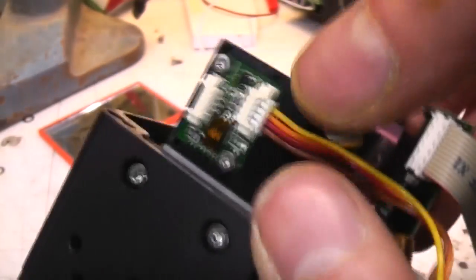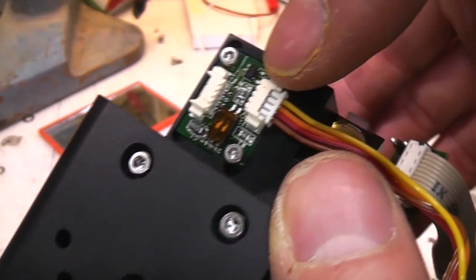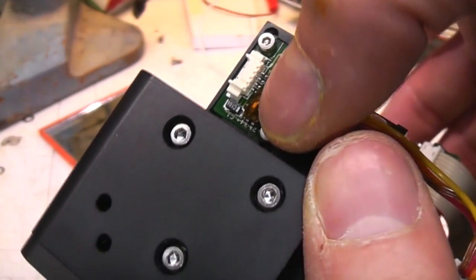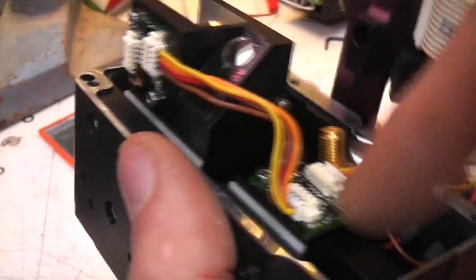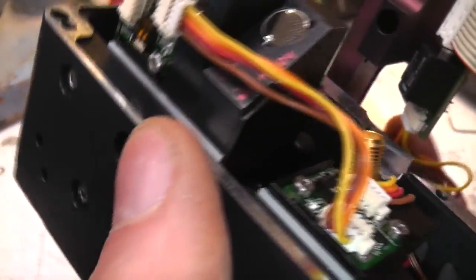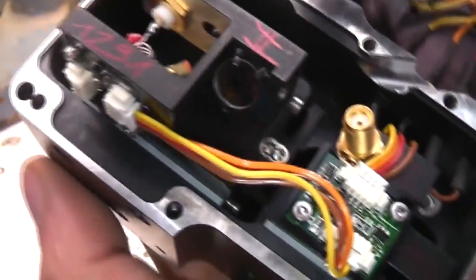And there's a couple of little boards on here. I'm certain these are going to be temperature sensors. They've just got a little SOT23 and a switch, which I'm sure will be setting the I2C address. So you've just got a couple of temperature sensors, one for each crystal there. And I'll be firing this lot up and having a play around with this optical stuff in a separate video.